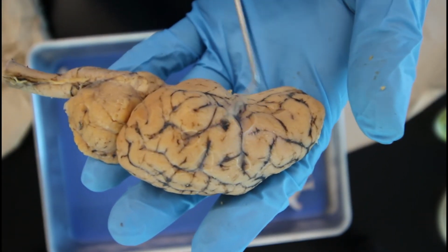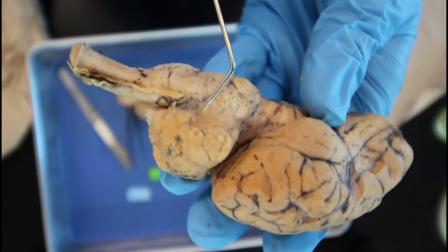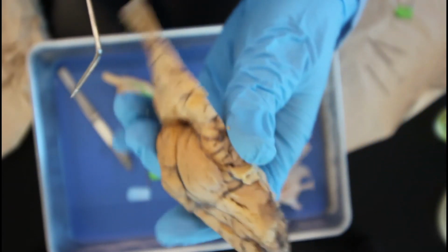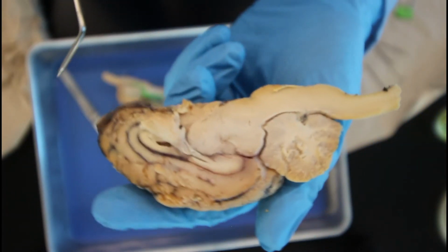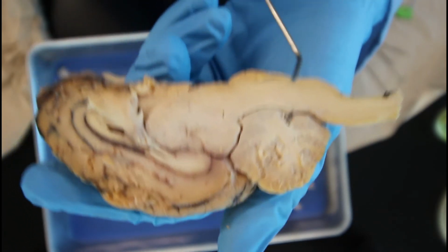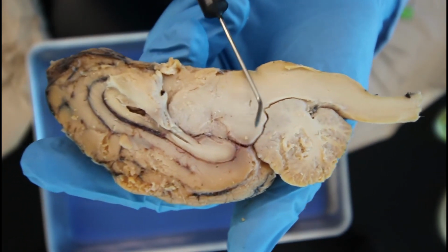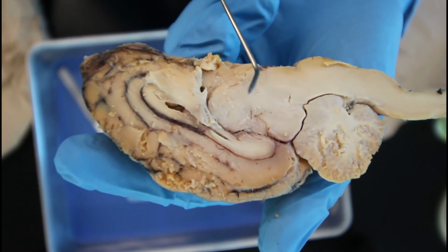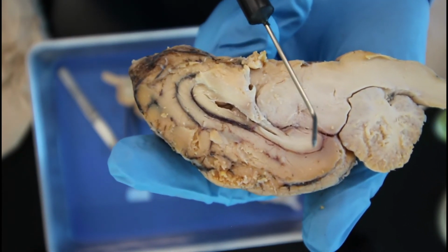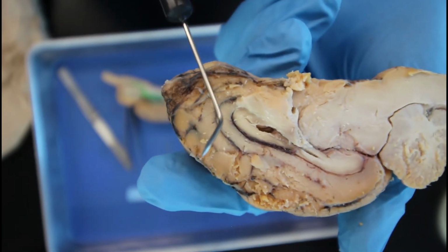Over here towards the back of the brain, or close to the spinal cord, this is the cerebellum. If you take a look, it looks like a small little brain itself, and in Latin it actually means little brain. The cerebellum is responsible for controlling muscle movement and tone, and it helps govern balance and helps regulate your movement intentionally. This is how you learn your motor skills, through walking or even just grabbing things with your hands.